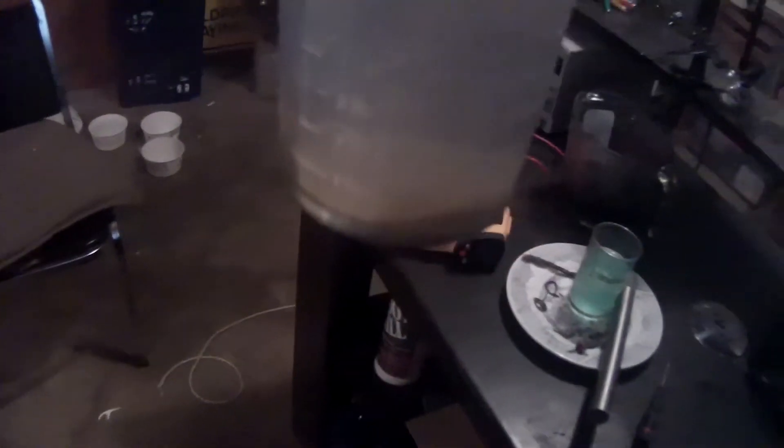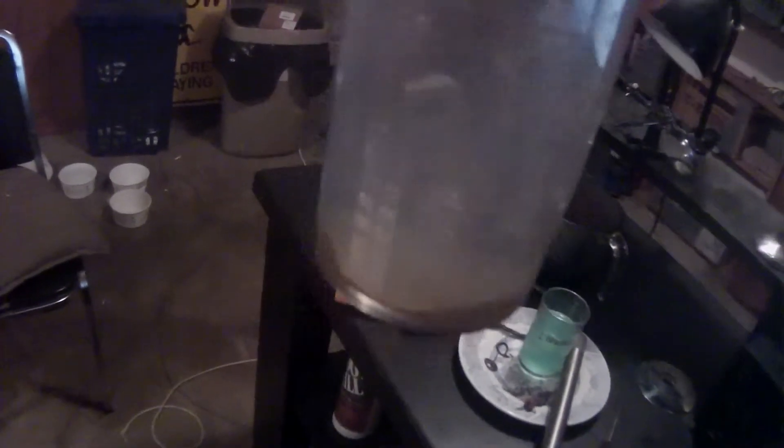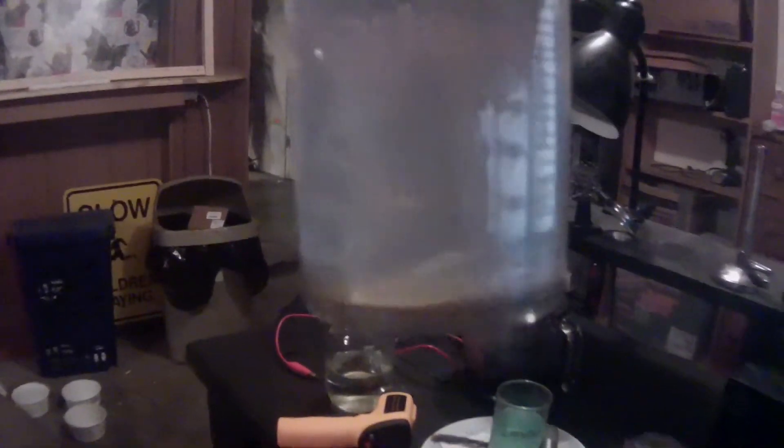This is the gold after I rinsed it and poured all that acid off. It's sitting in water right now — I'm just letting it finish settling to the bottom. As you can see, it's still a little bit murky. It's just the gold powder settling down; that's the brown mud you saw at the bottom of the acid. Once it's all done settling, I'll drain off the water and scrape this into a crucible and melt it down to get our gold.